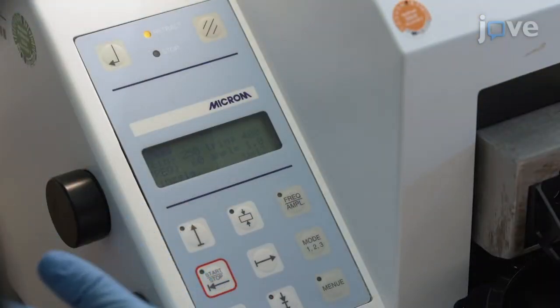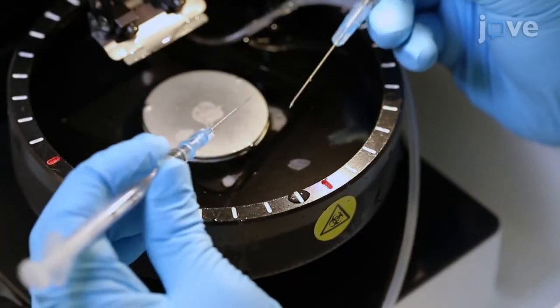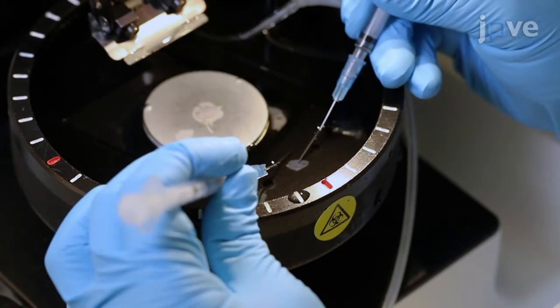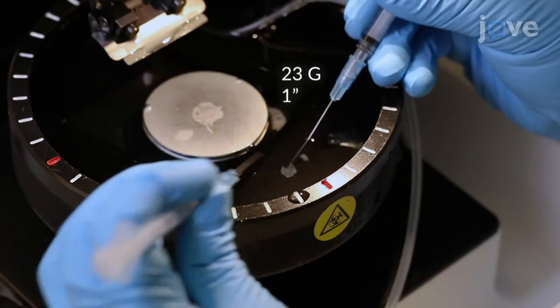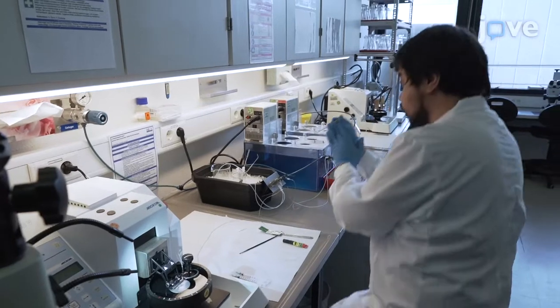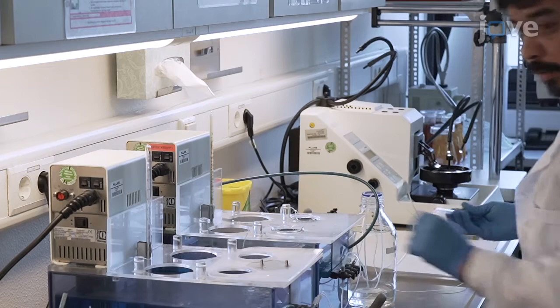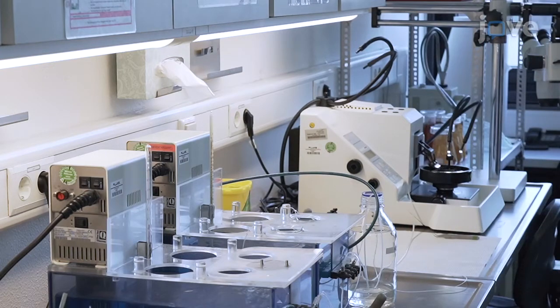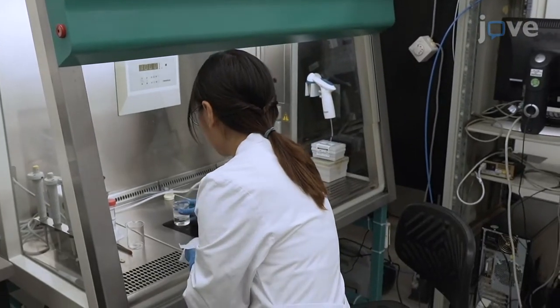Adjust the vibratome to cut slices at 250 to 400 micrometers. After cutting the slice, identify the hippocampal formation based on its typical morphological appearance and isolate it using hypodermic needles, keeping the part of the cerebral cortex adjacent to the hippocampus. Place the slice on a mesh in ACSF warmed to 34 degrees Celsius and bubbled with 5% carbon dioxide and 95% oxygen until all the slices are collected. Transfer the slices to the laminar flow cabinet to continue under sterile conditions.